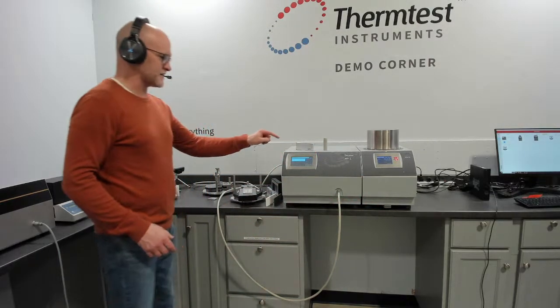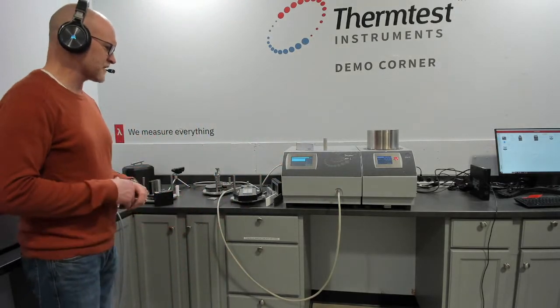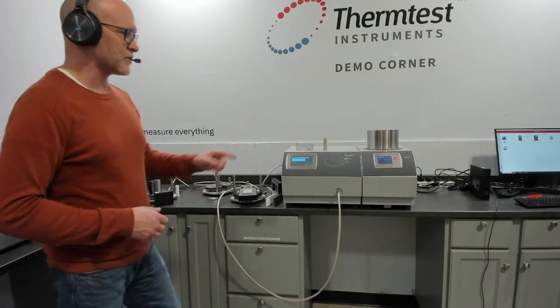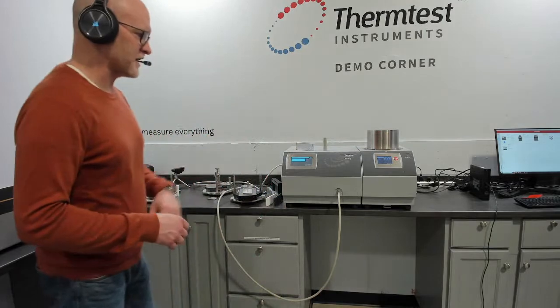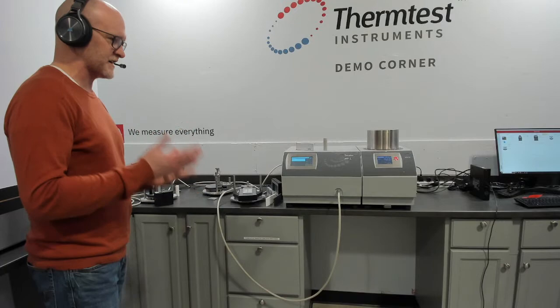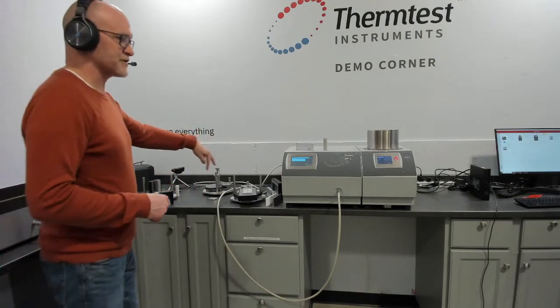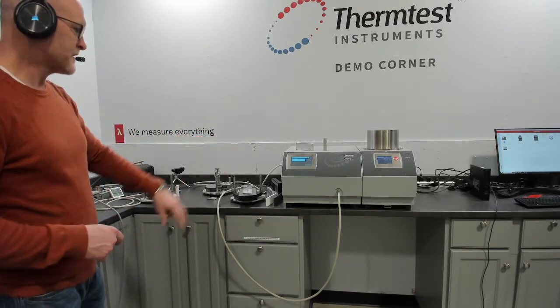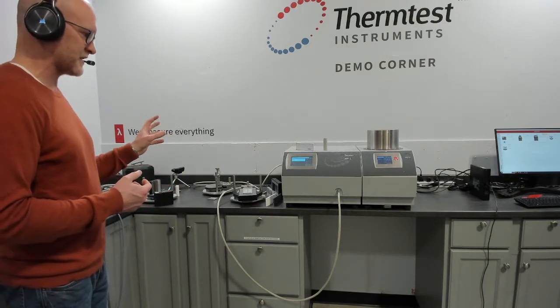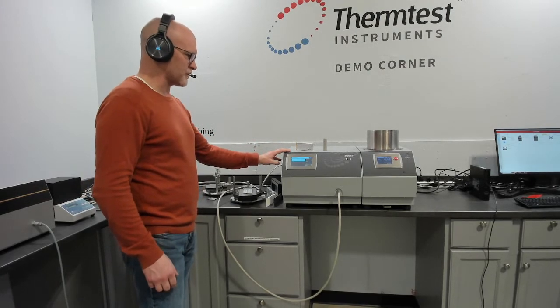So this unit has 4 channels, 1 in the front, 3 in the back. We have smart software that allows you to use the same controller to operate up to 4 sensors or 4 chambers, whatever that combination of methods and/or sensors that suits your requirement for testing or volume of testing. Today we have several room temperature sensors plugged into the same controller just to allow simple demonstration, but it still does give you an idea on the versatility of having that switch. Some of the other key features of the MP-1 are its high frequency rate.